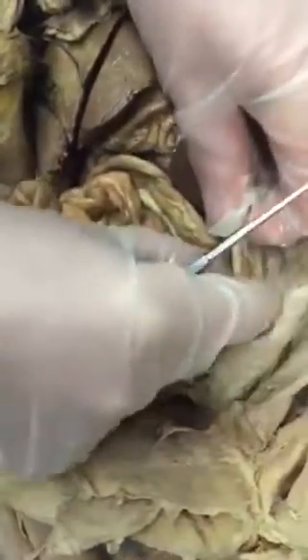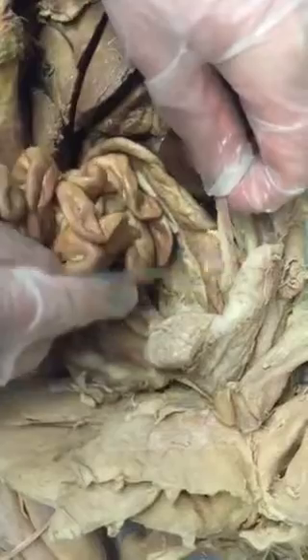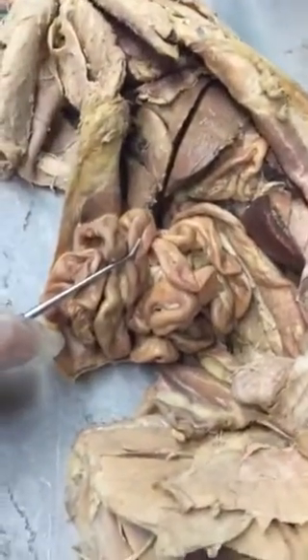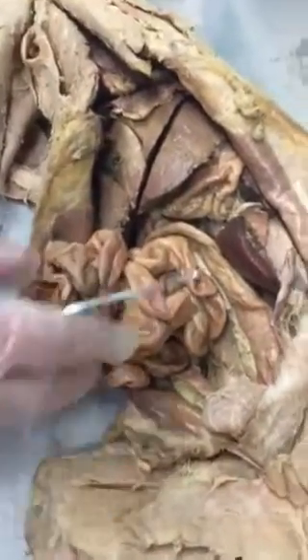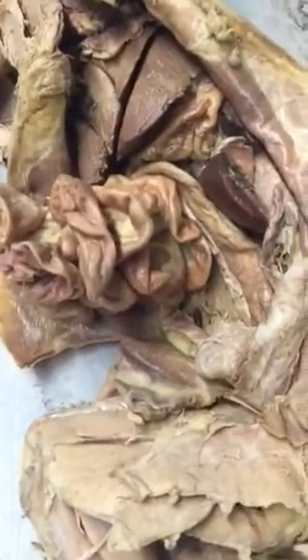Kitties come from there. So if the cat was pregnant, the fetuses would be in the horns of the uterus. This cat's not pregnant because you see how thin the uterus is. Imagine if this cat was pregnant for so long. You've been using this cat for like 2 years. Yeah, the uterus would be like the size of this, right? For 2 years.